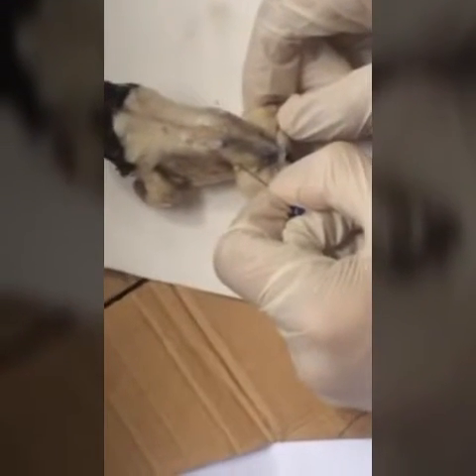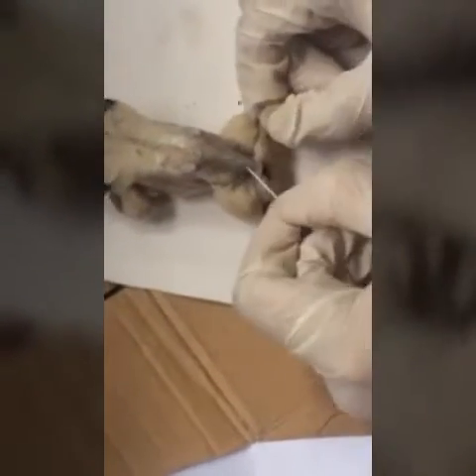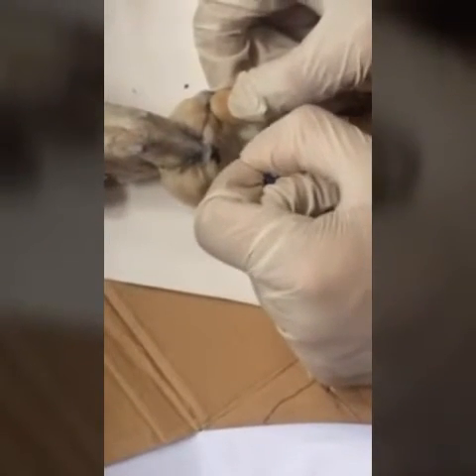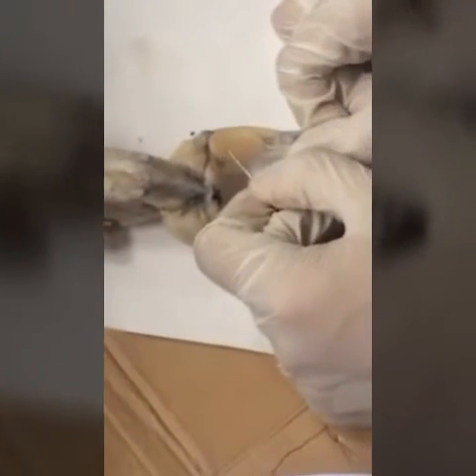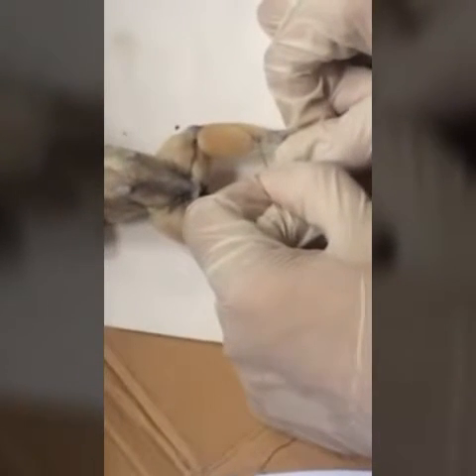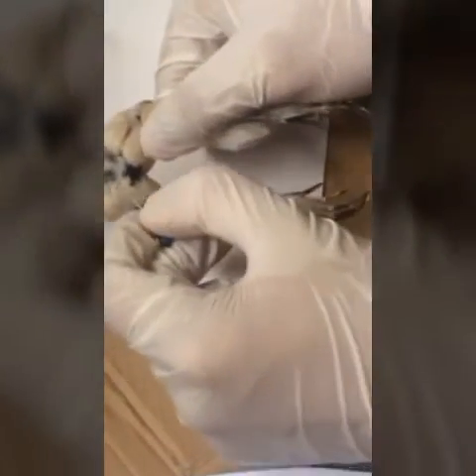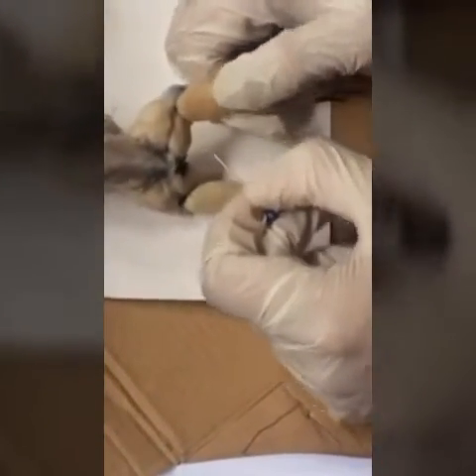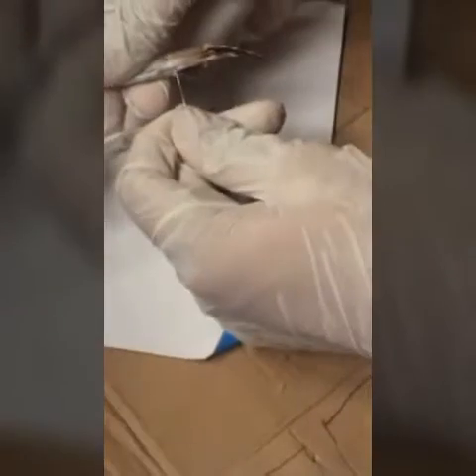Then you can see the triceps femoris muscle here. Then the biceps femoris over here. Then we have the peroneus and the gastrocnemius. The tibialis anticus right over here. We also have the piriformis, which are the two visible dotted structures right over here. Then we have the tendon of Achilles right over here.